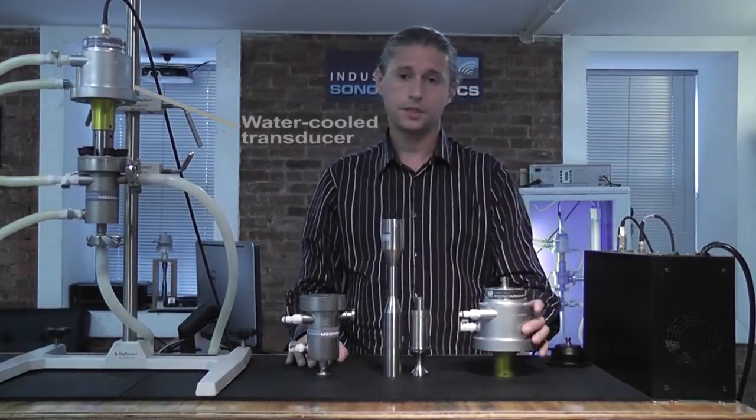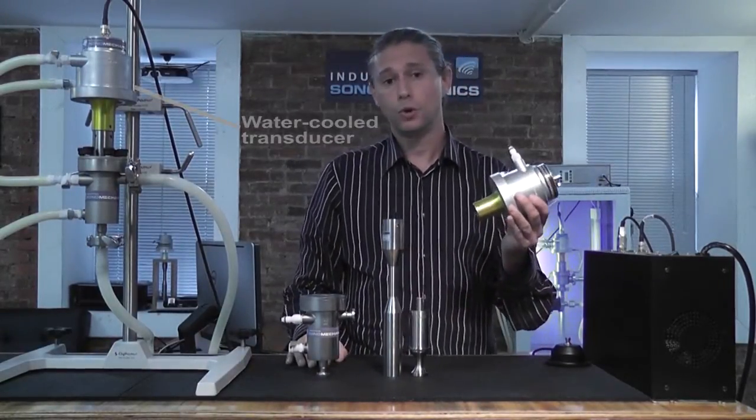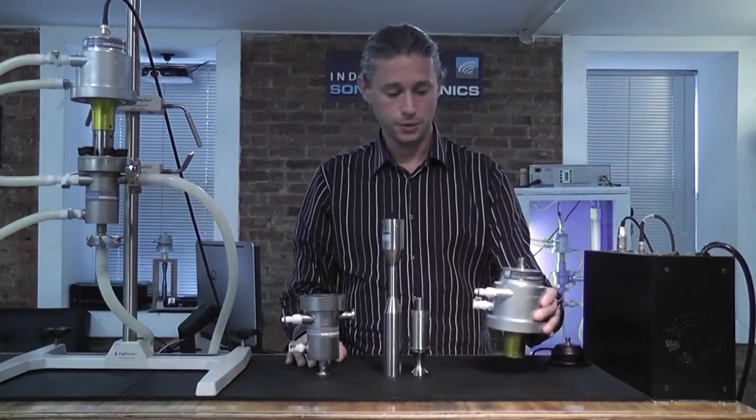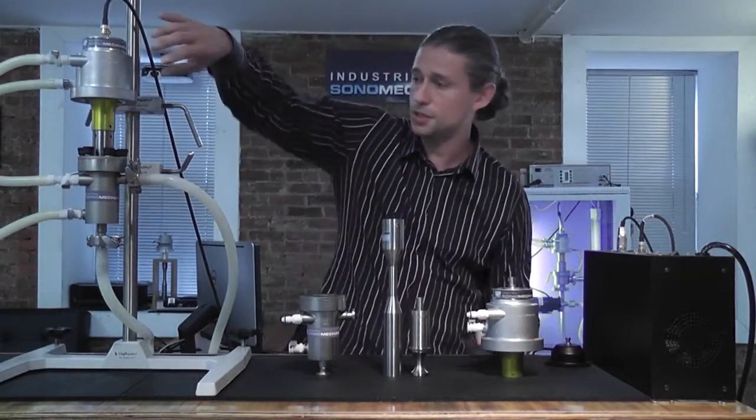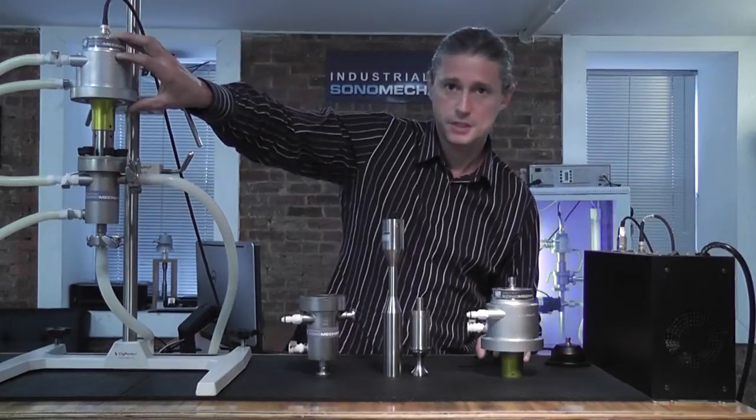Component number two is the sealed, water-cooled ultrasonic transducer. You have this at the top of the assembly here.